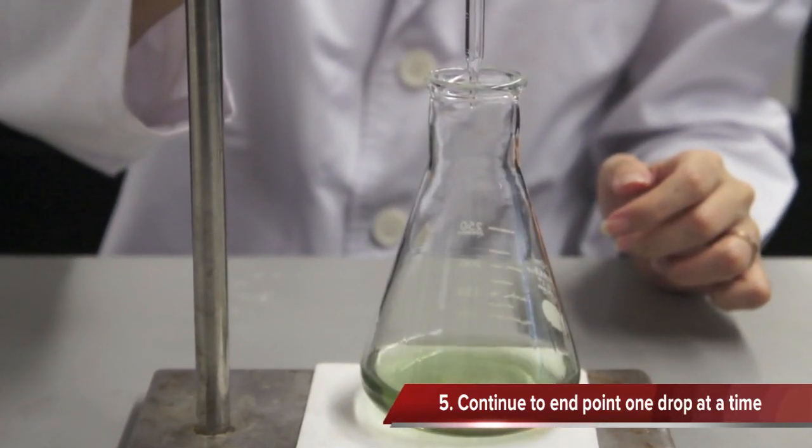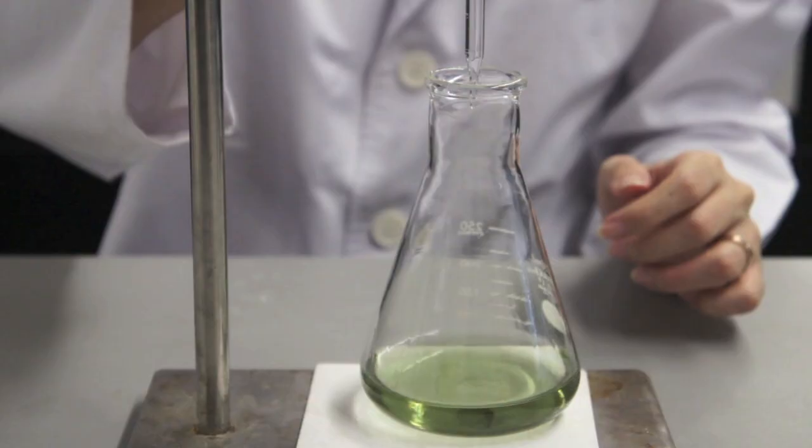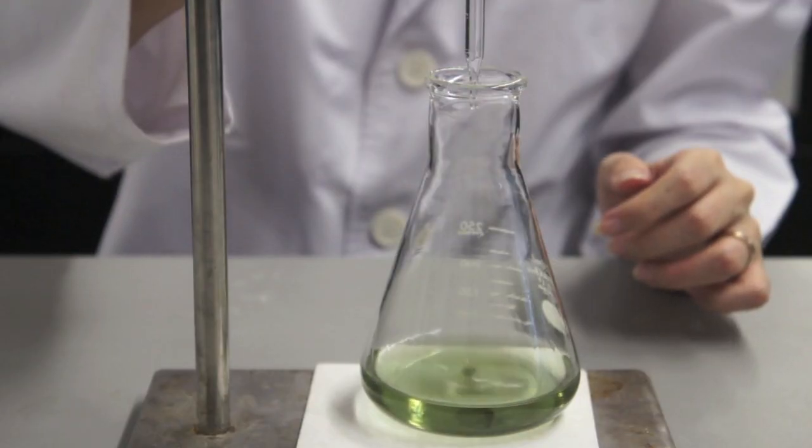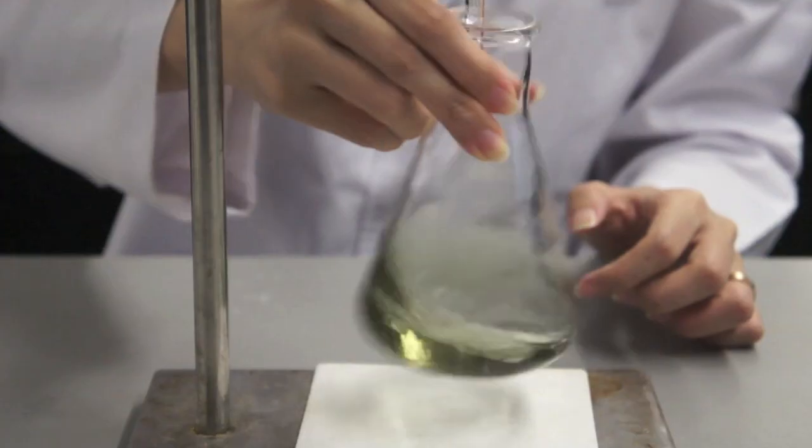Continue to the end point, one drop at a time. Carefully add another drop from the burette and mix the solutions thoroughly.